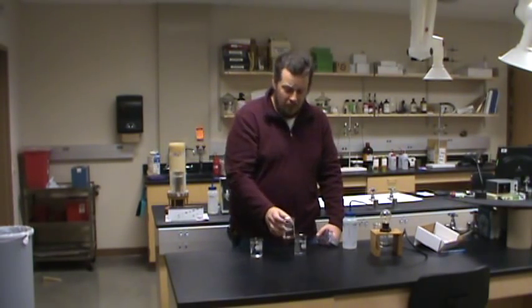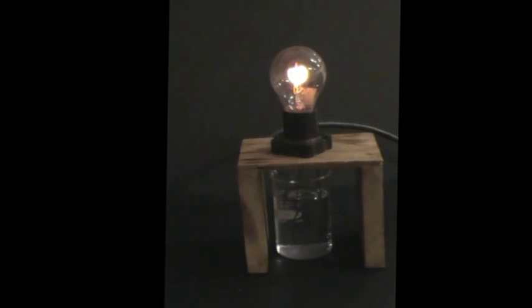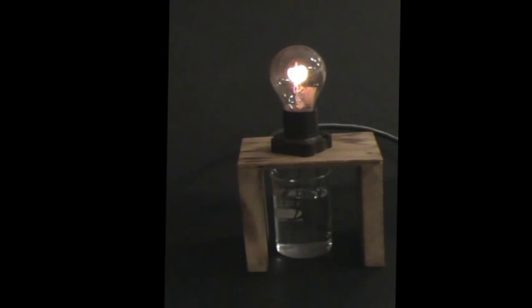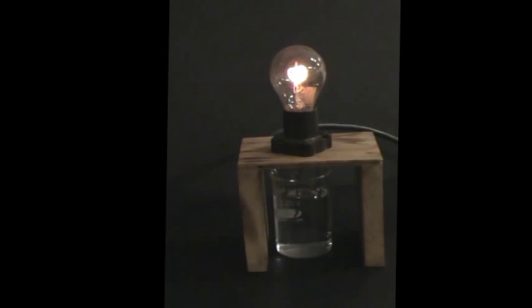I have a beaker here of tap water — I just filled this off the cold water tap in one of the Gen Chem labs. When we test the conductivity of the tap water, the light bulb lights up a little, not nearly as bright as for the salted water, but it still lights up. That tells us there's still some conductivity, so tap water must have some residual ions that could potentially affect our results.